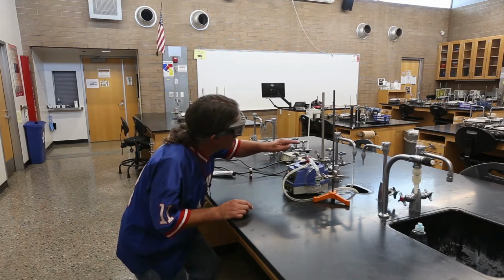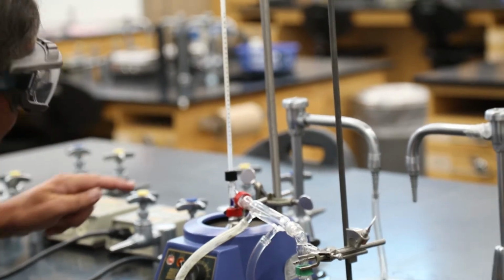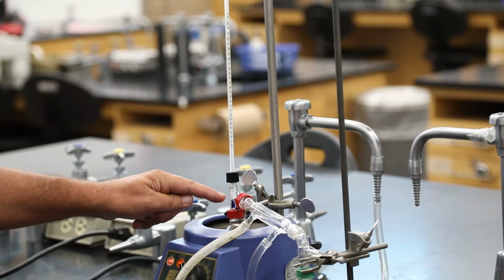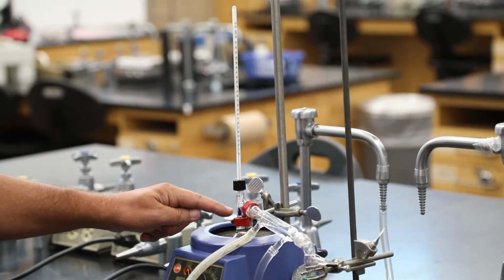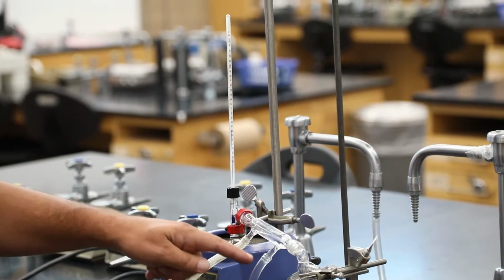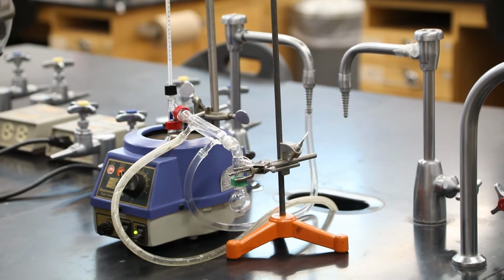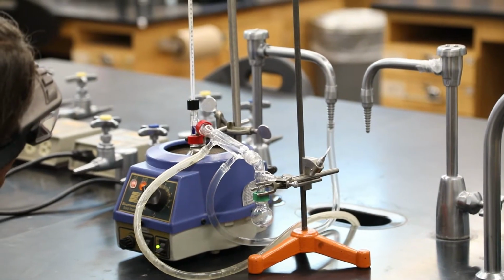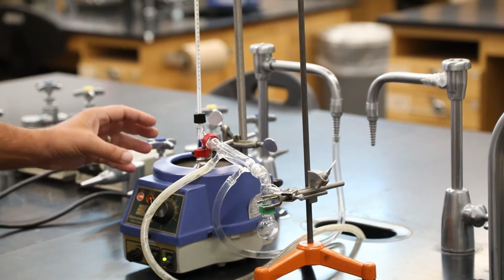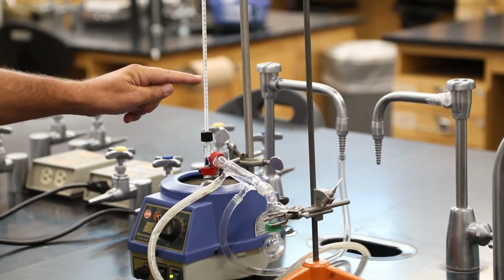I've noticed as I've been talking, the temperature has risen from 30 to 55 as the liquid is starting to condense on the thermometer. Now we're starting to get close to the boiling point of the liquid. When the first drops start to come out into the receiver flask, that's pretty much going to get, hopefully, the boiling temperature of the liquid. And we'll watch. We'll keep heating and keep heating. And this temperature should not change.